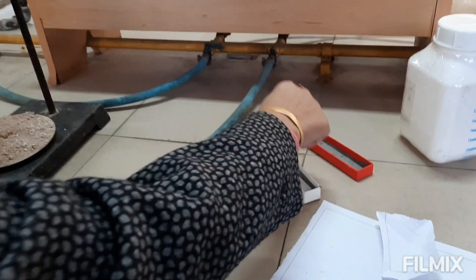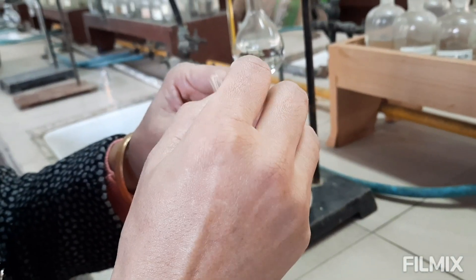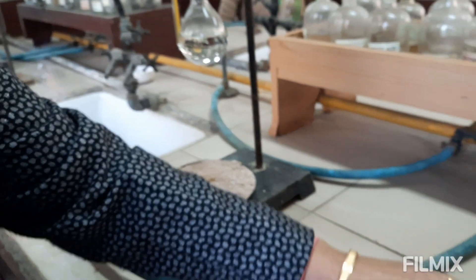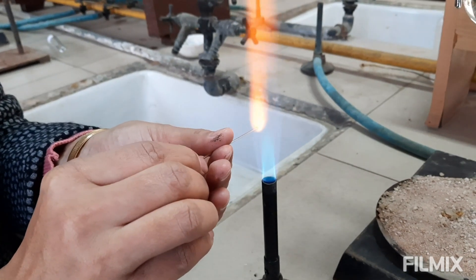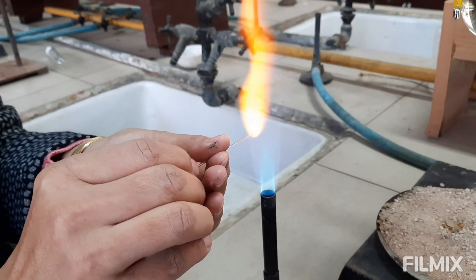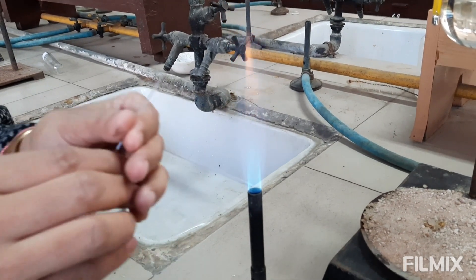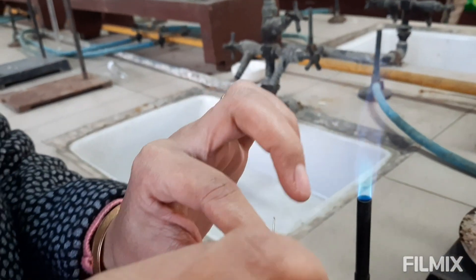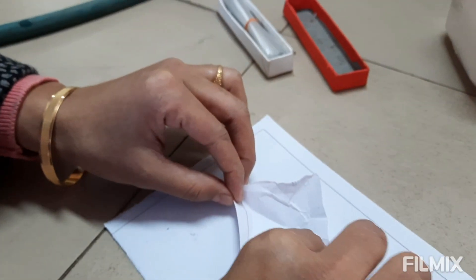To determine the melting point, first a capillary tube is used — it is sealed at one end using a burner. Then finely powdered compound is filled inside the capillary tube and a compact column is made.